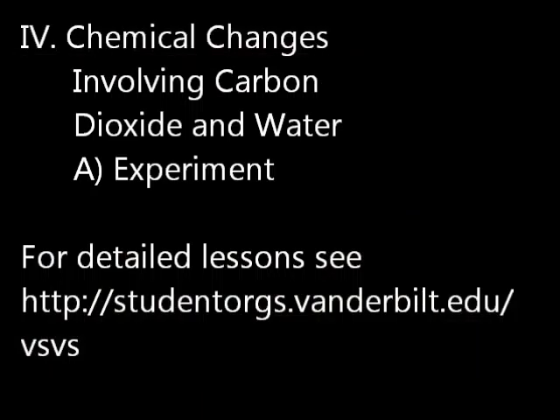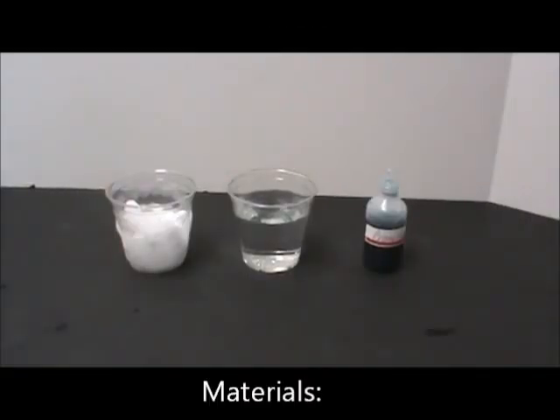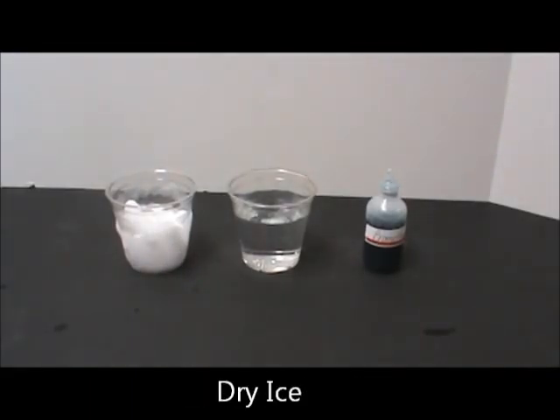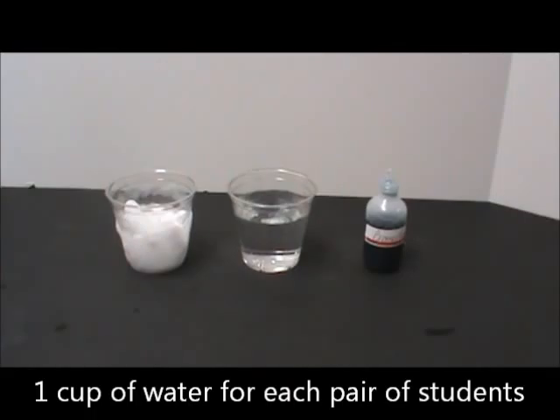Chemical changes involving carbon dioxide and water. Experiment. The materials needed for this experiment are bromothymol blue, dry ice, and 1 cup of water for each pair of students.